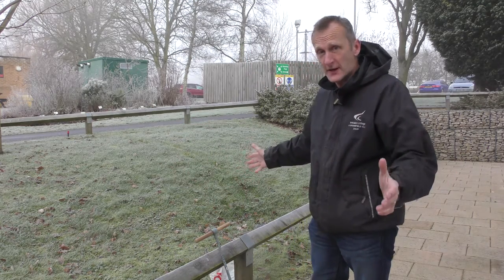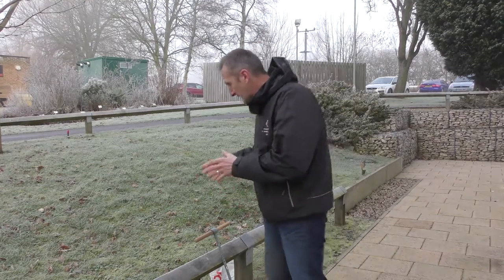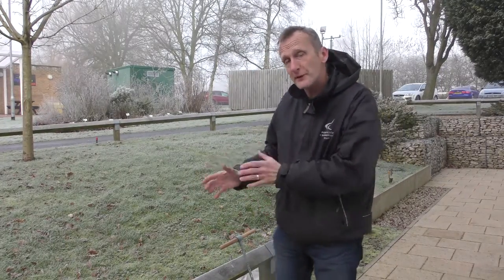Welcome everybody. Today we're going to have a look at doing a soil test. We've got this fairly rectangular area here and we want to make sure we've got a sample that's representative of the whole area. It's quite important to get a representative sample because you can be biased — for example, someone might have tipped some lime or sand in one spot, making it completely different from the other side.